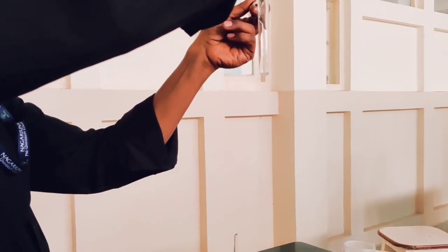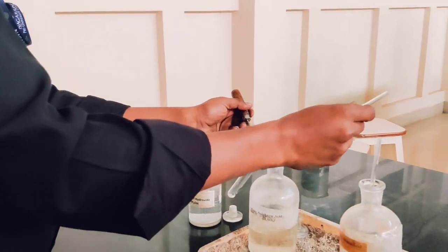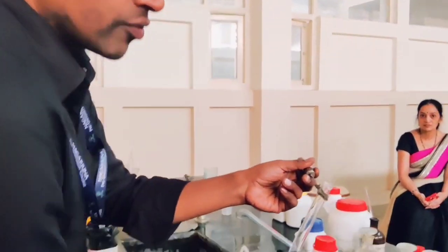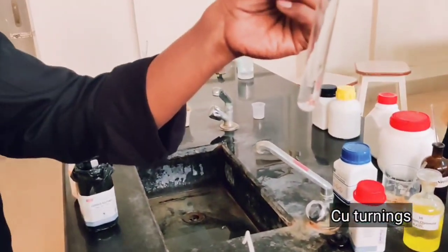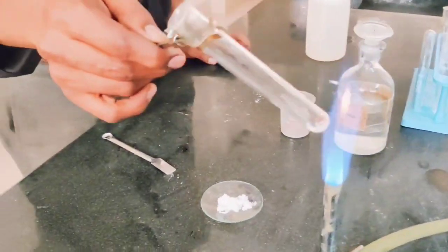We add slowly from the sides of the test tube, and we notice no reactions and no fumes are coming — no white fumes or brown fumes. So we can conclude that chloride and bromide are both absent in the given salt. We can do the test for nitrate by adding copper turnings. We add copper turnings to the solution and heat it. After heating we check the observation.